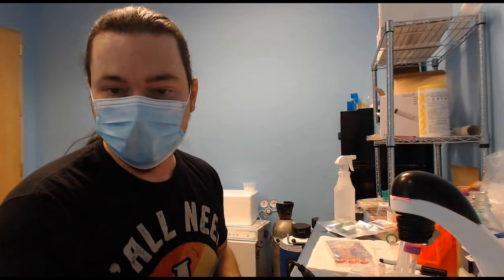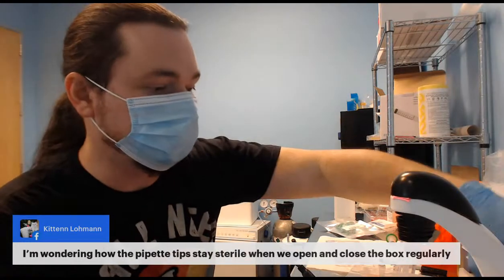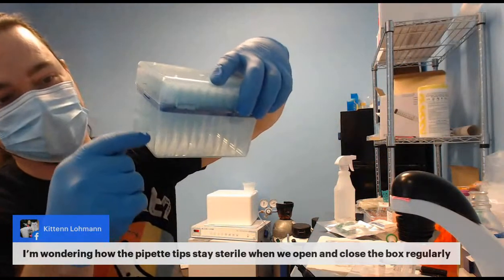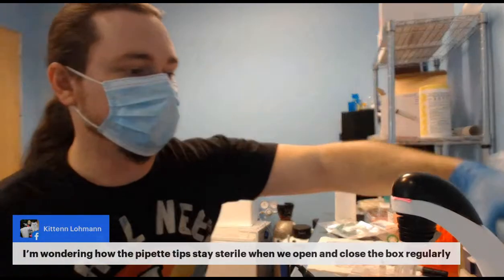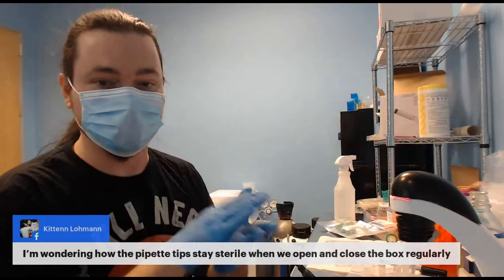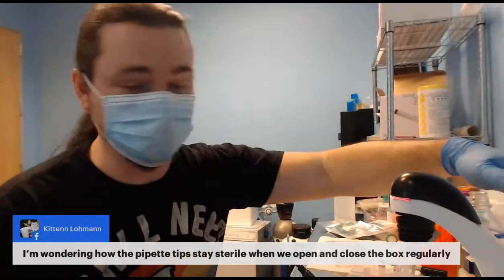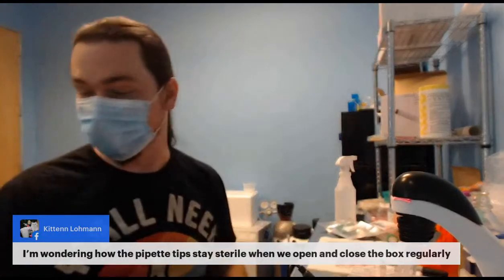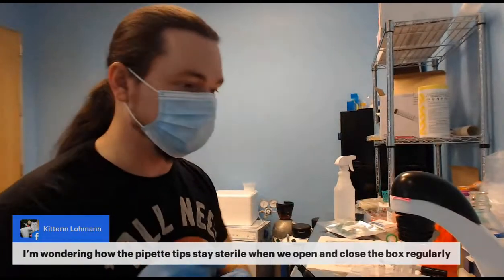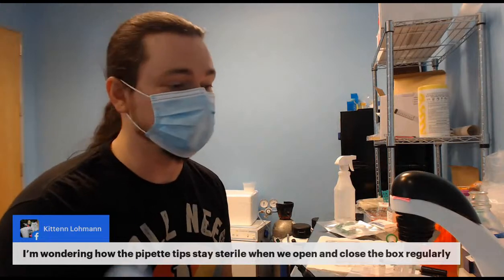So here's a question. Wondering how the pipette tips stay sterile. It's just because they're down there underneath, and there's not really anything going on down there. You don't touch them. Try to keep the lid closed on your box as much as you can. Anything that's going to get contaminated is probably going to be the top, which is not the part that touches anything. And you shouldn't get liquid all the way up to the top near where your pipette is. But no, there's nothing about them that keeps them sterile. If you touch them to something that's contaminated, they'll be contaminated.